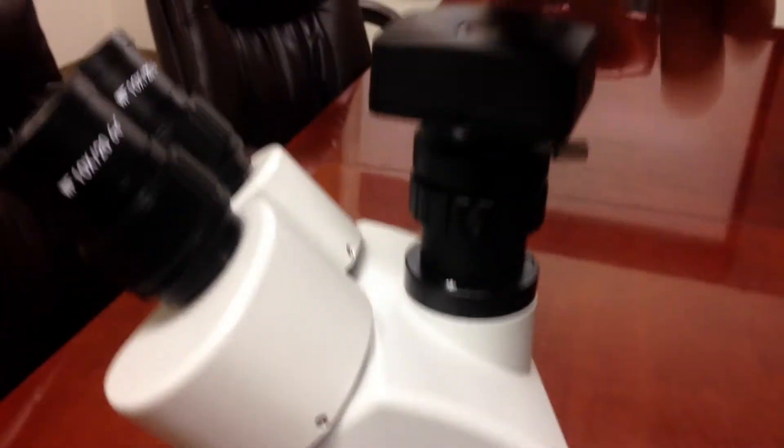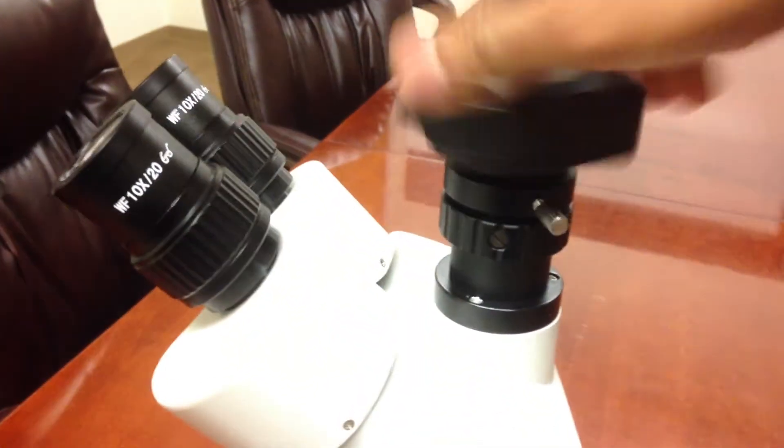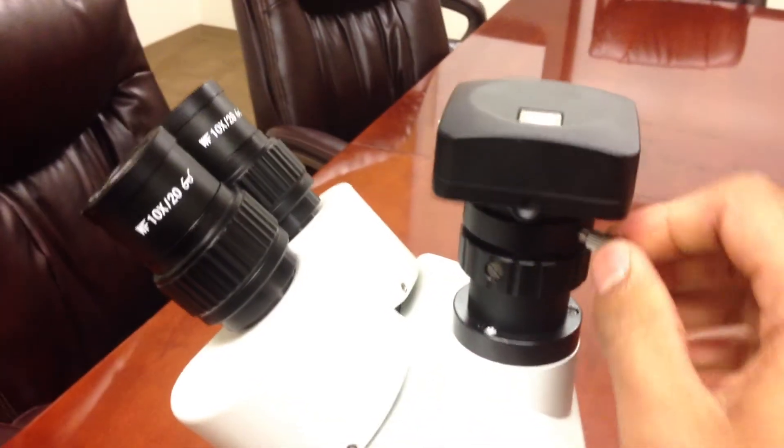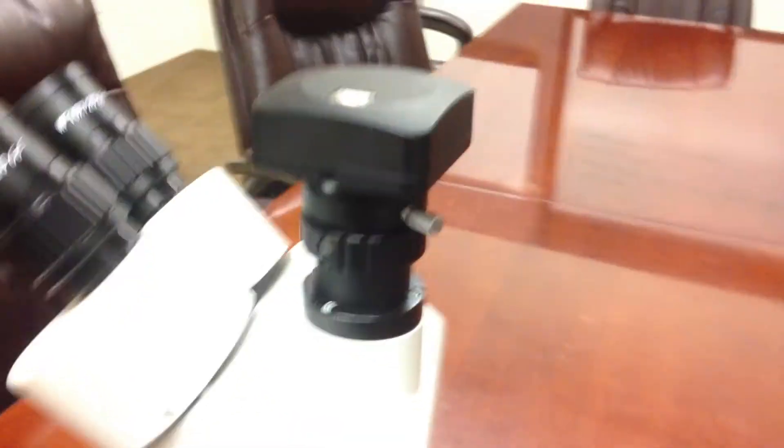And you go ahead and screw this onto the adapter on top. Just like this. And make sure those two are secure. And there you go.